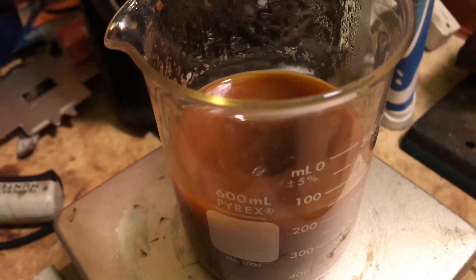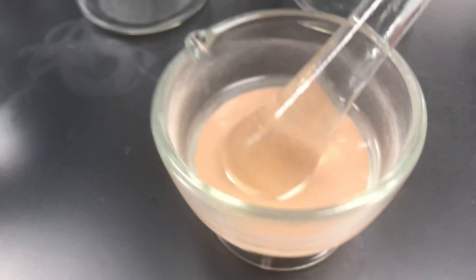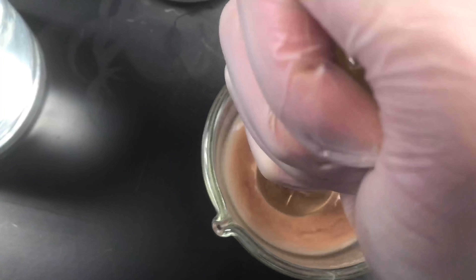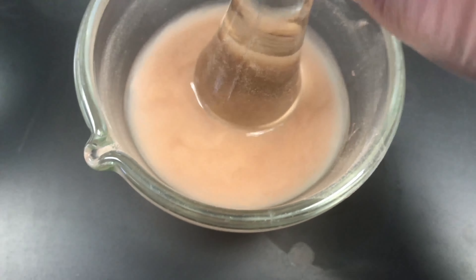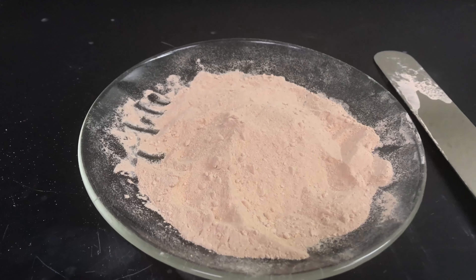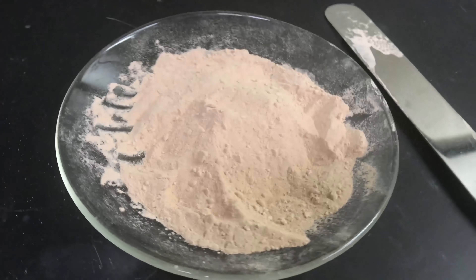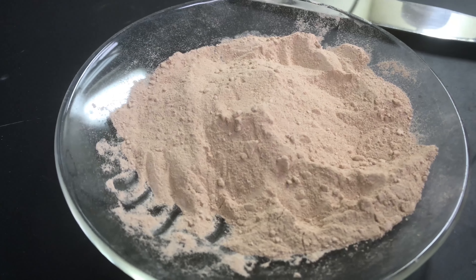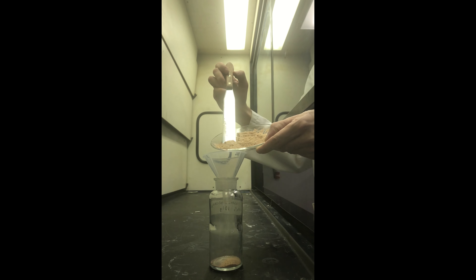Eventually this led me to the point where I was grinding the dried salt under acetone, which ultimately produced results I was happy with. It looks like what it's supposed to look like — a pink powder. I was still somewhat suspicious because when you dissolve it in water, it forms a suspension rather than a complete solution. I read that there could be mixed oxidation states leading to this, but it was decent enough for my purposes.